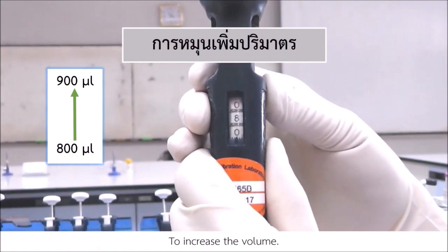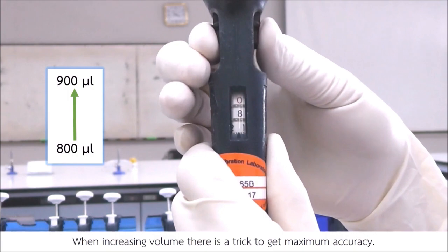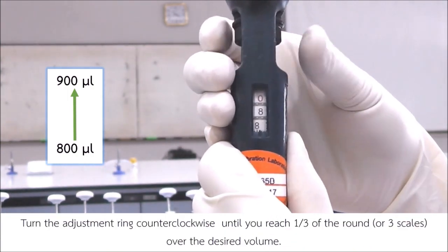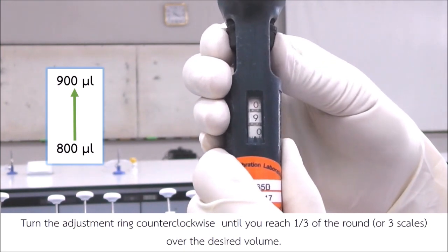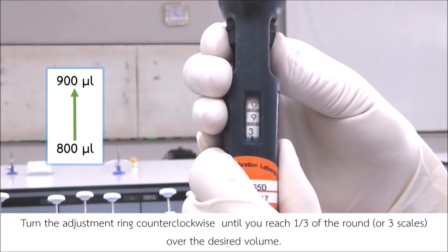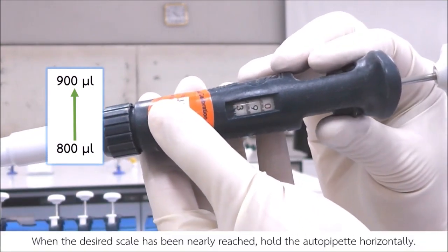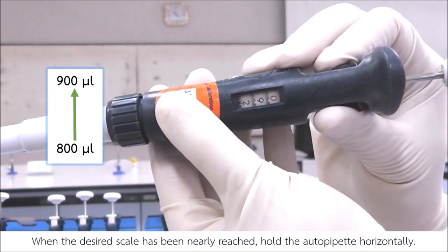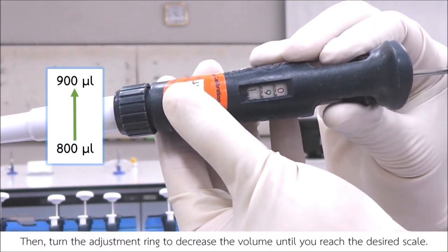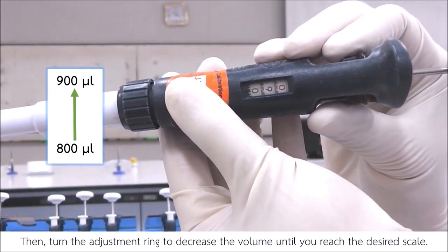To increase the volume. When increasing volume, there is a trick to get maximum accuracy. Turn the adjustment ring counterclockwise until you reach 1/3 of the round, or 3 scales, over the desired volume. When the desired scale has been nearly reached, hold the autopipette horizontally. Then, turn the adjustment ring to decrease the volume until you reach the desired scale.